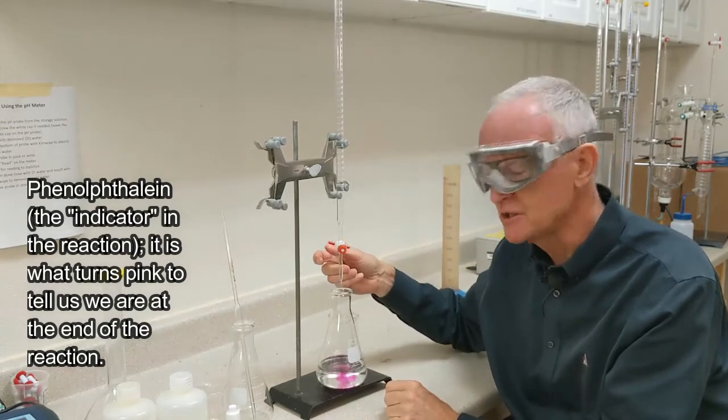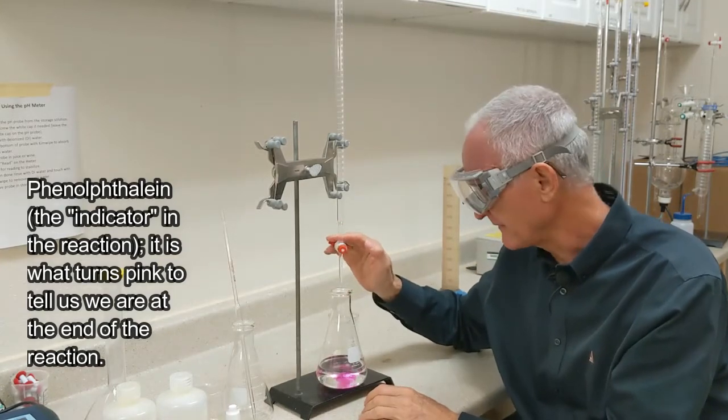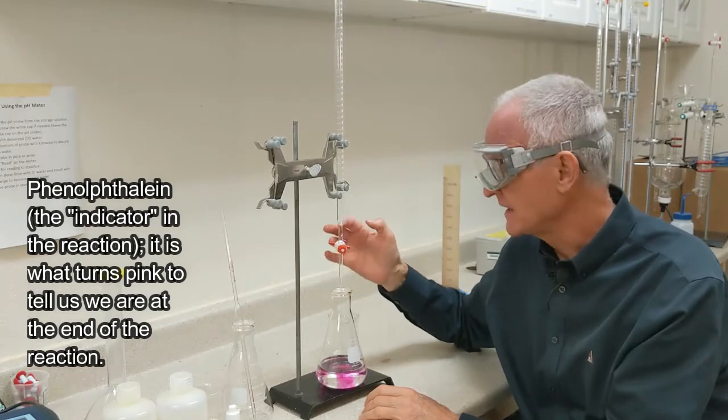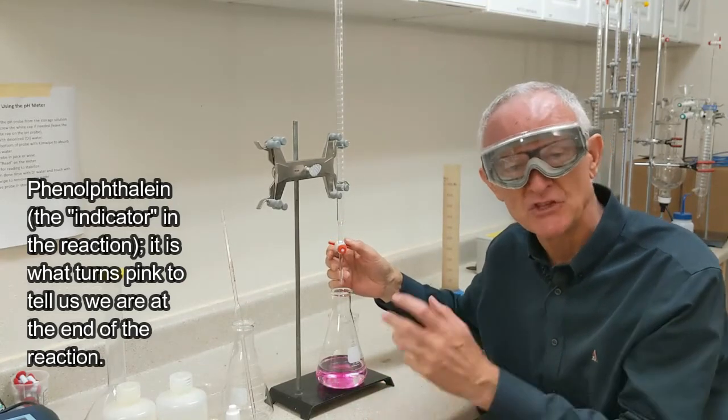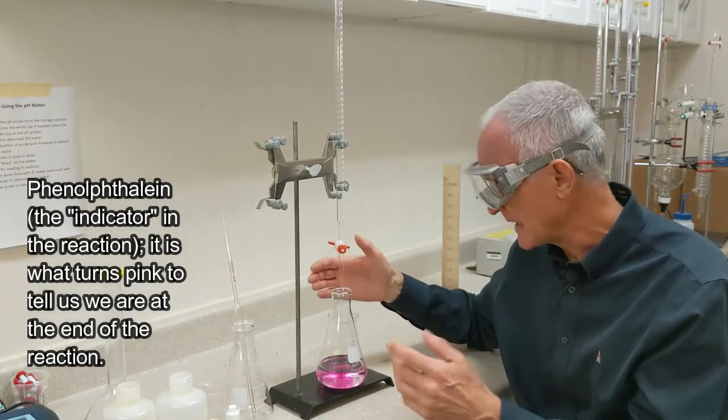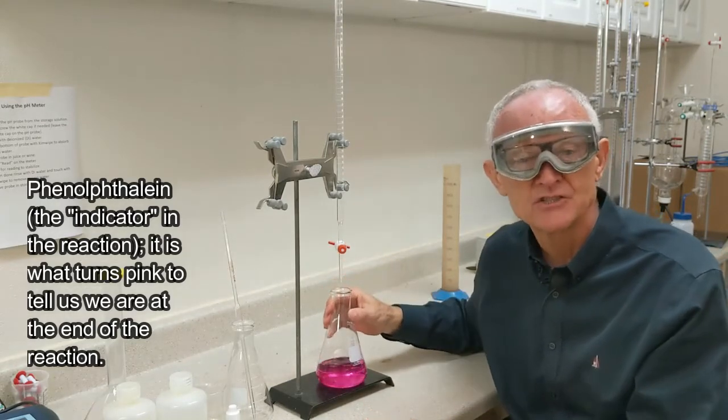And so you'll get a feel for how to turn this stopcock such that you get a slow drip. Now that was way too much. So this stopcock I found out, I just found out, is very, you turn it just a little bit and you get a pretty big flow. So you got to get to know your apparatus.